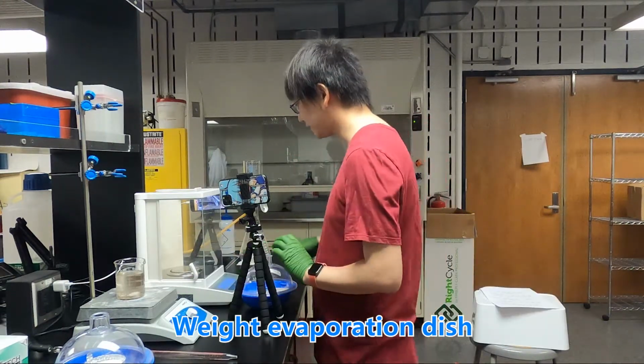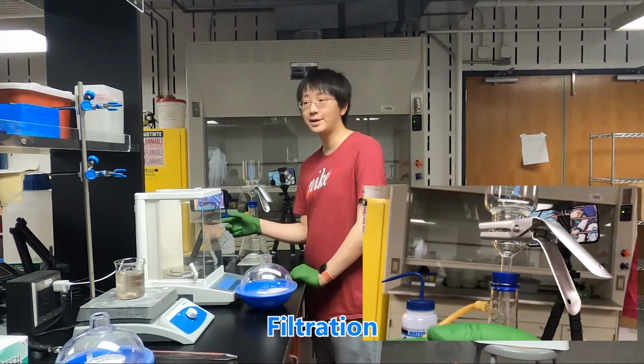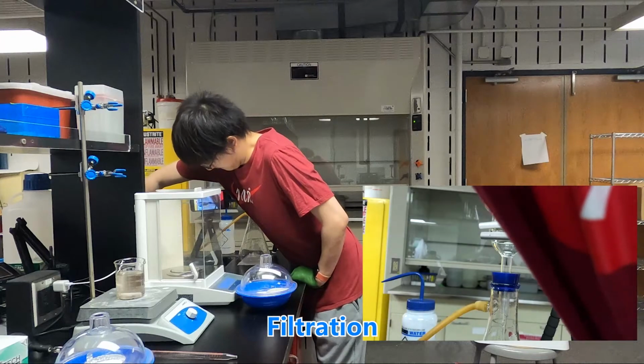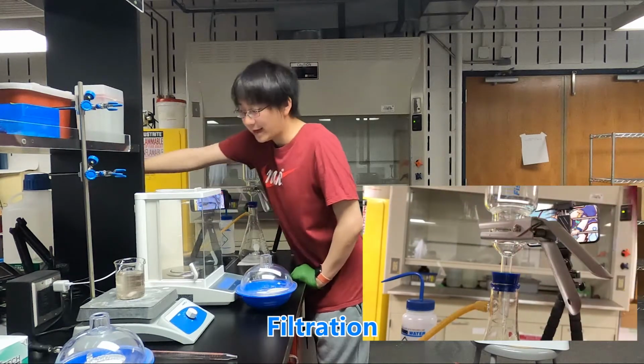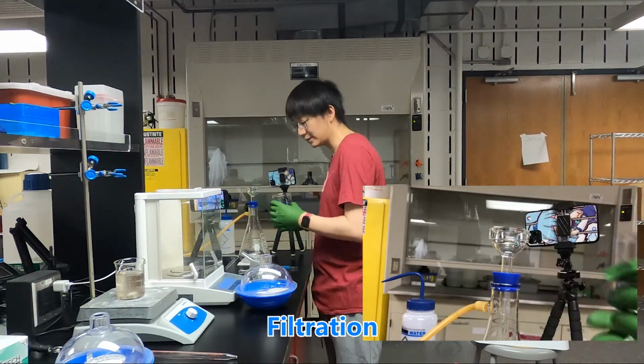And the next step is filtration. So this is our filtration stage. And when we open the cap, it can create vacuum. So before we use it, we need to rinse it.